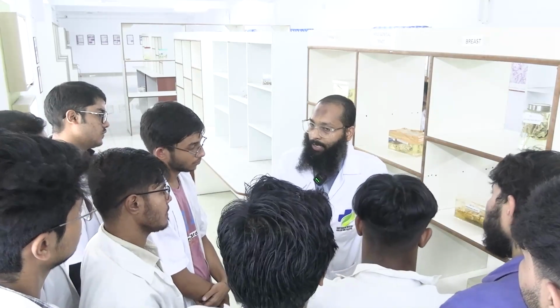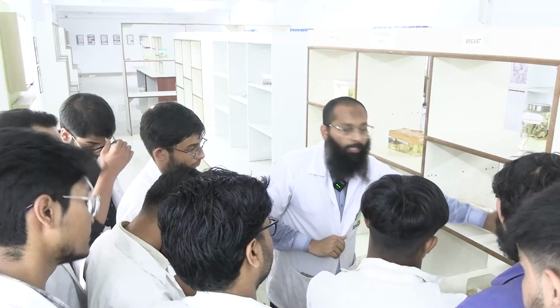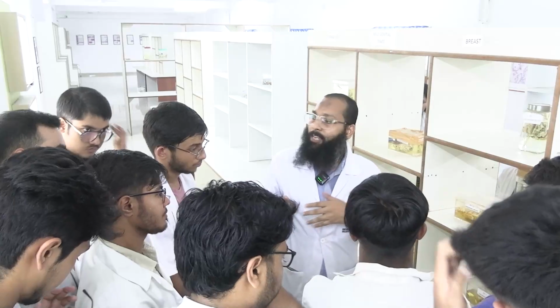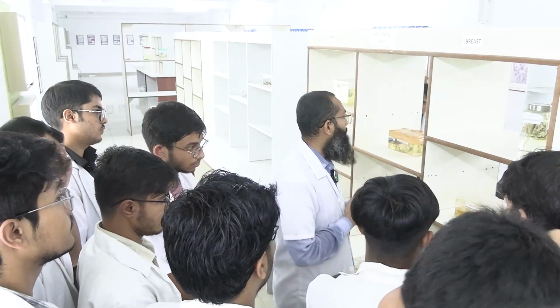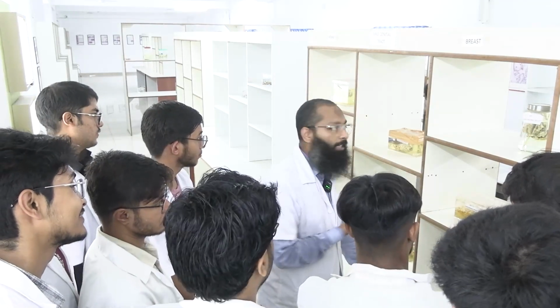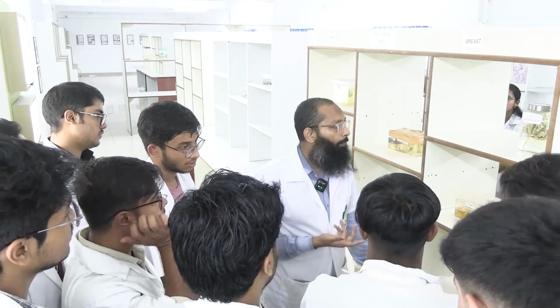Okay, clear? So if I am getting this specimen, there is one term called cold ischemia. You all know what ischemia is? Does everyone know? Who doesn't? Then tell me, what is ischemia? Not hypoxia.